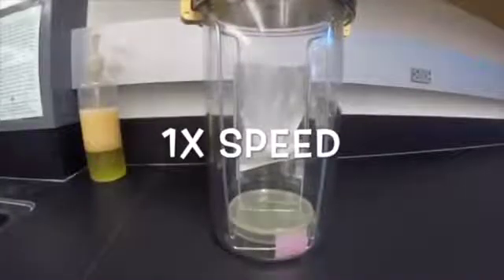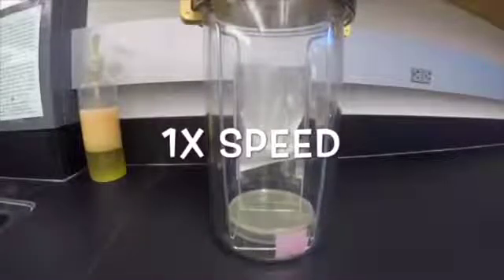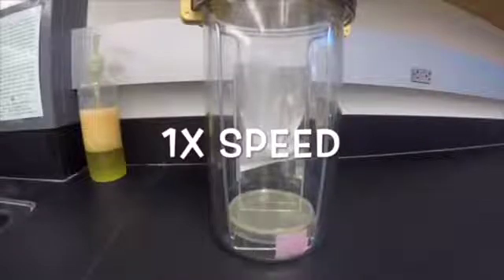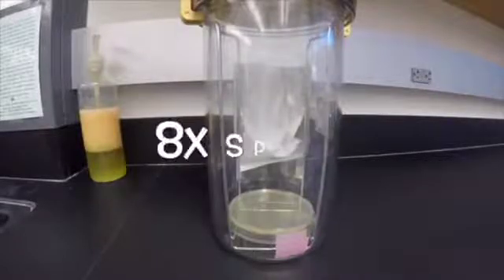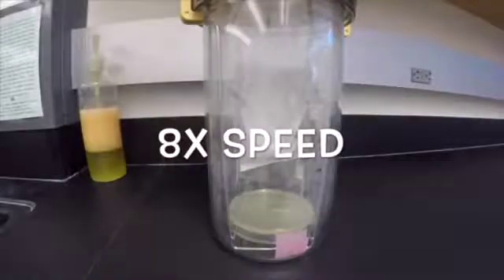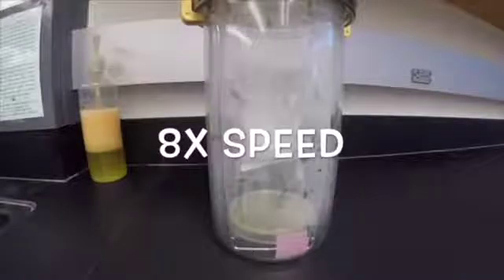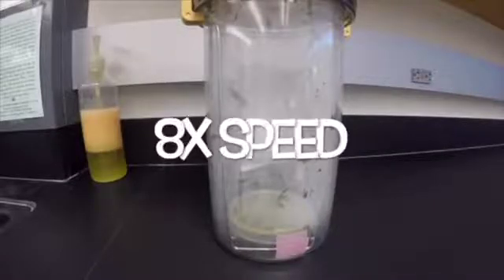For demonstration purposes, we have left this container outside of the incubator to observe the chemical reaction as it takes place. You can see here as we speed it up, over the course of about an hour, water vapor quickly condenses on the inside of the container. Because of the moisture inside, it is important to place the plates upside down to avoid contamination from condensation.